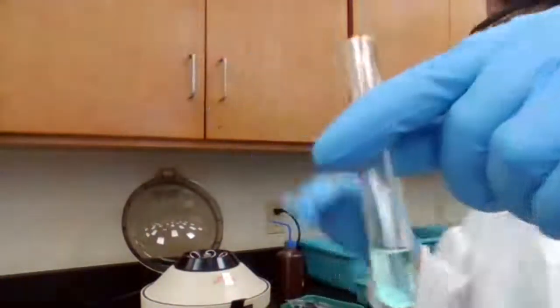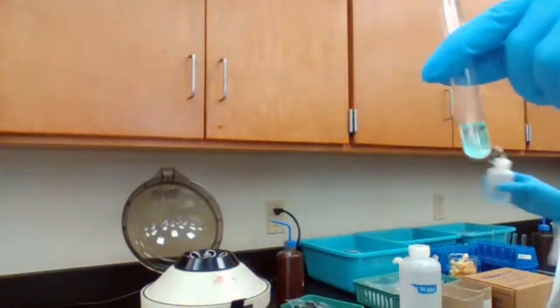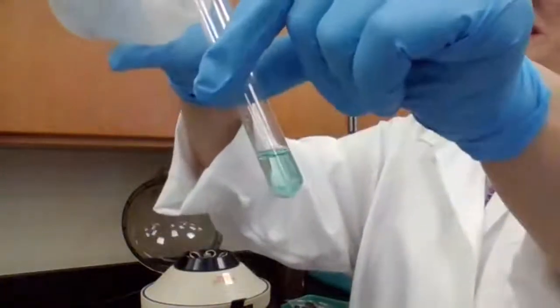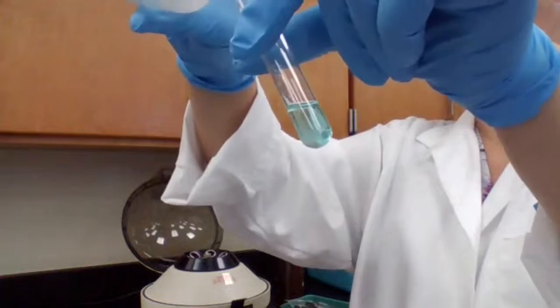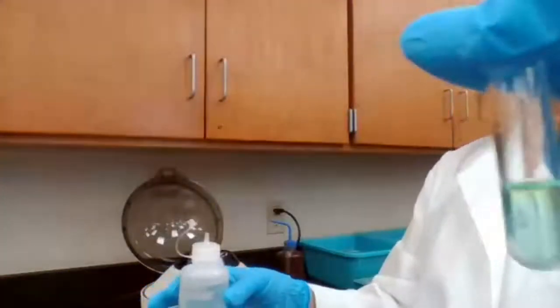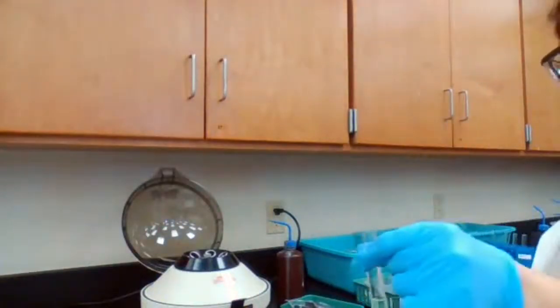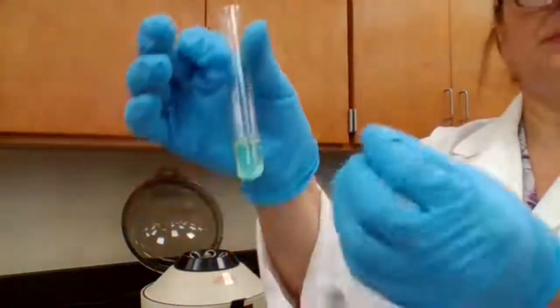Without disturbing, on the next step, it says add additional drops of the HCl and see if the new precipitate is forming. Okay, I add 2 extra drops and no new precipitate forms. So this means that everything of the silver and lead already precipitated.